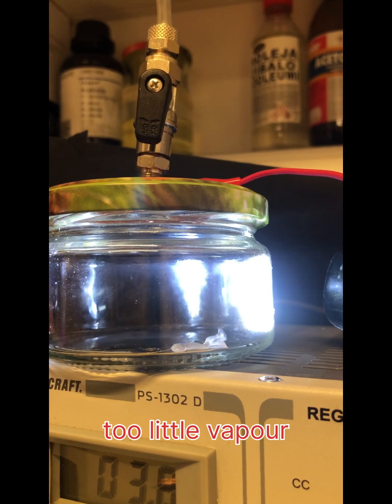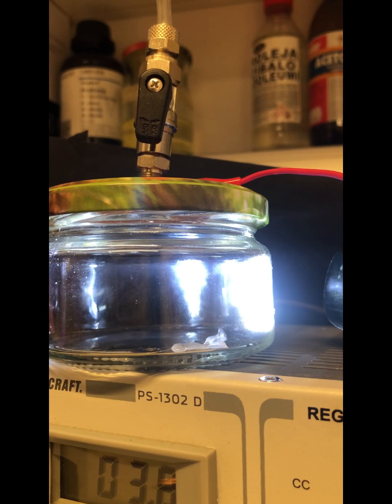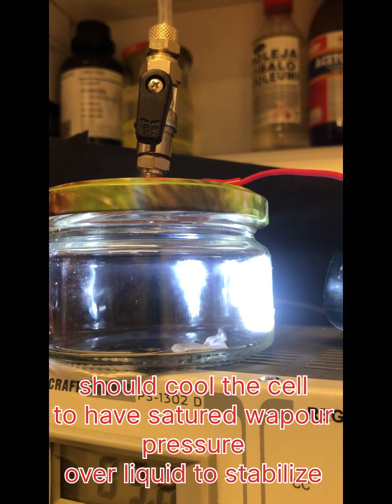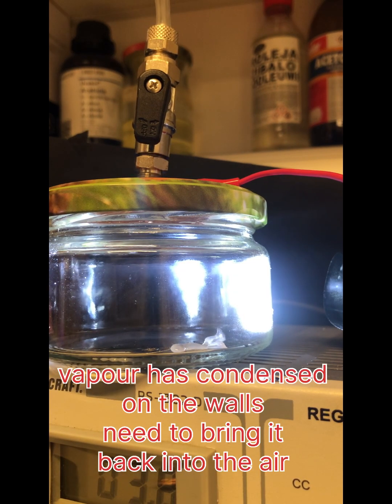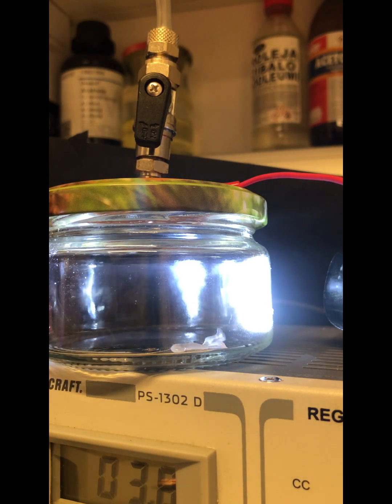There are no tracks. There is a very narrow region in which there are tracks. We have pumped out too much vapor. In principle, vapor pressure should be controlled by temperature. We need to mix things to have much vapor in the air and let it settle down a little bit, and now pull, and we have tracks.